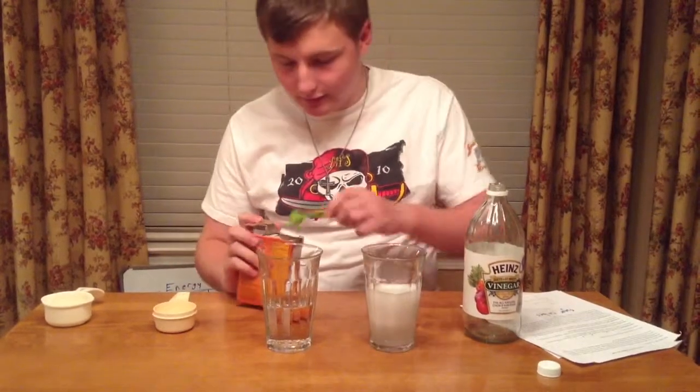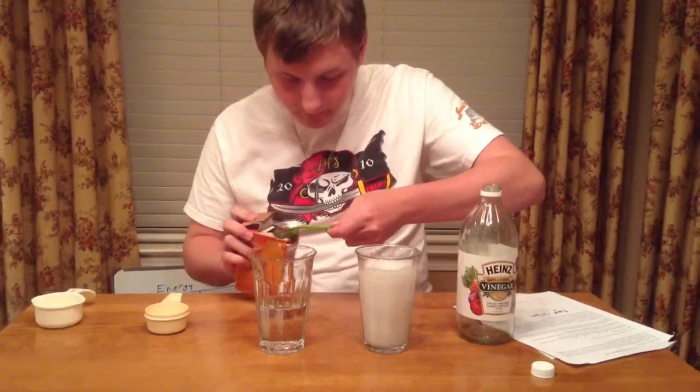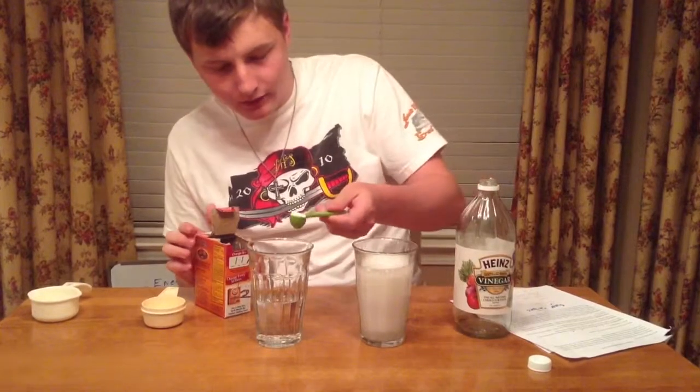So that reacted pretty fast. Now let's see how the water reacts.